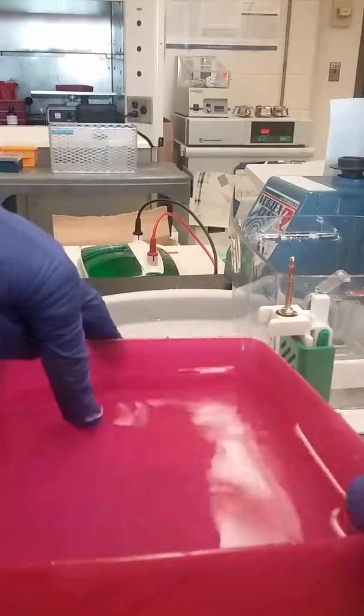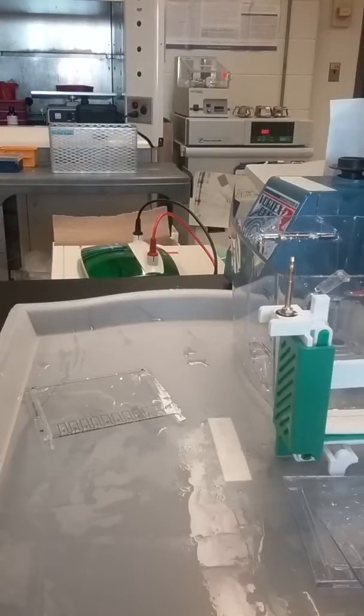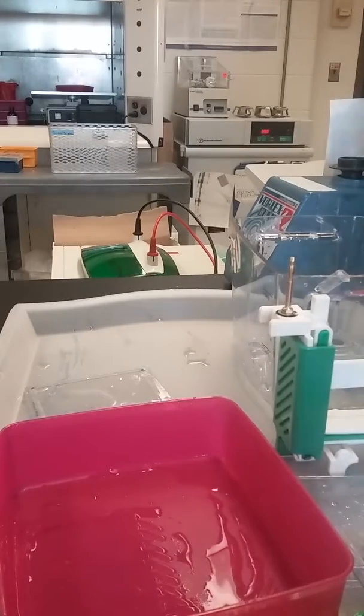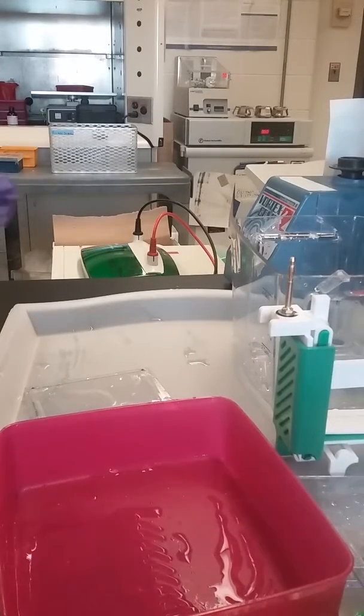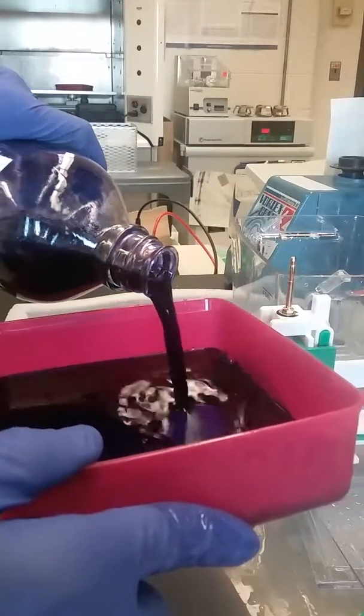We're just going to pour this off, put in Coomassie blue stain, and we'll be good to go. Let me do that right now. Here's our Coomassie blue stain going into the gel.